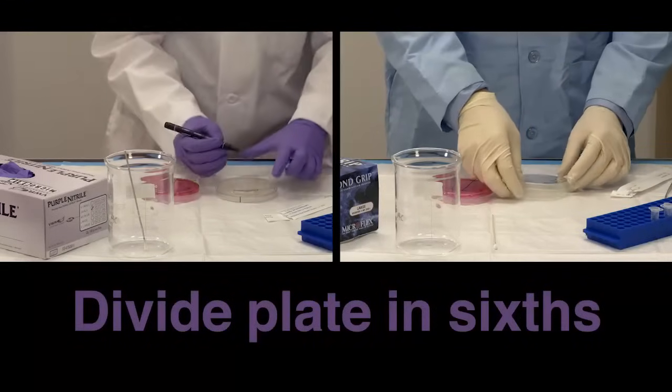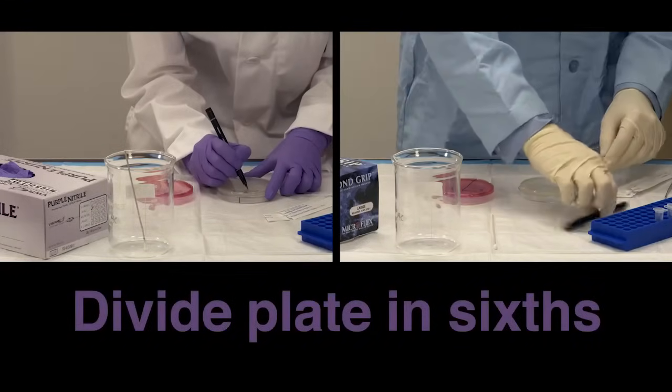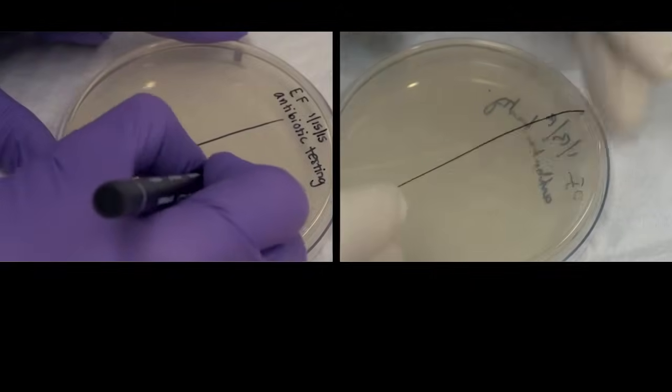Divide the plate in sixths. This will help you evenly place the antibiotic discs.